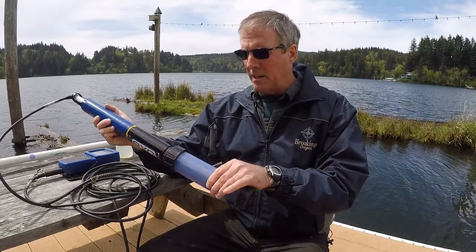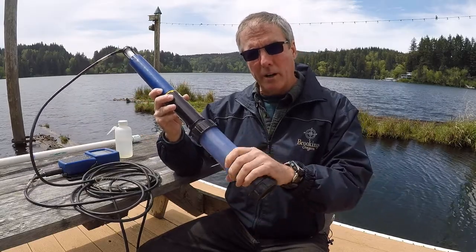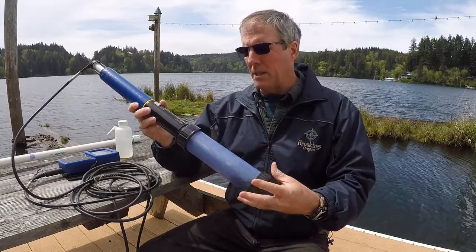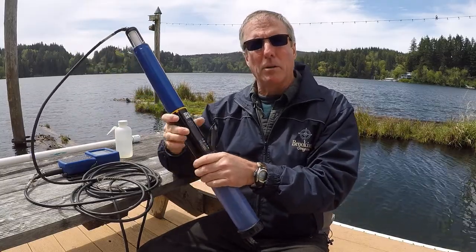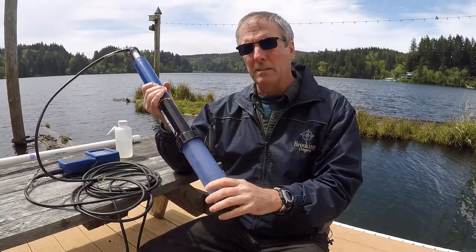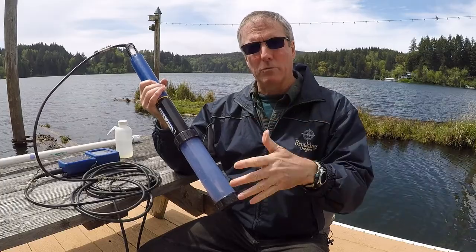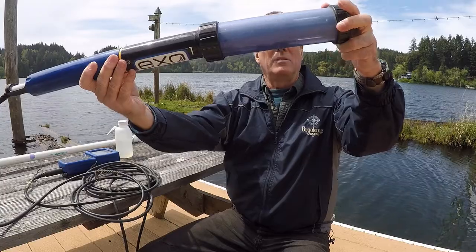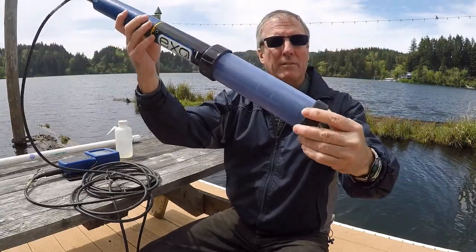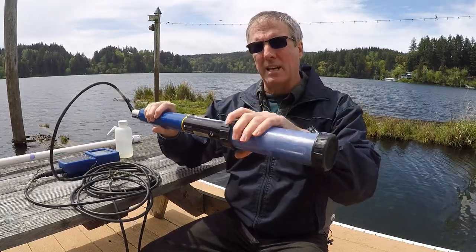It's got a protective casing that it's stored in. There's always water in here. You always want to keep some amount of water just to keep those probes moist. Like on our multi-parameter probe, we always put the pH probe in a pH tube, and when we were traveling from site to site, we always wrapped it up in a wet towel, if you remember right. It's kind of the same thing with this. We just want to have a little water in here. You actually don't want the water covering the pH. You just want to keep the whole environment inside moist.